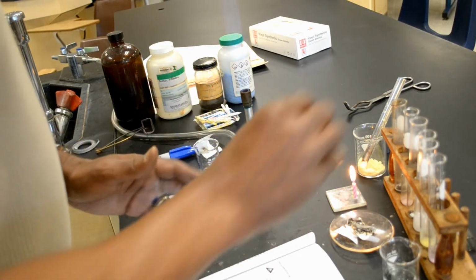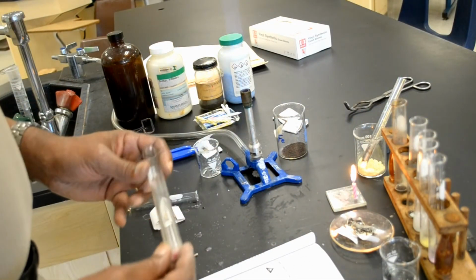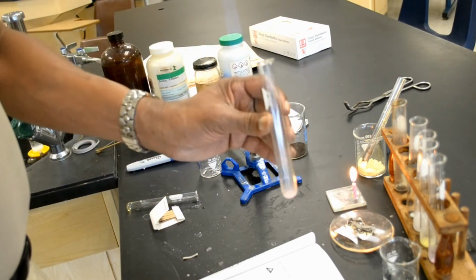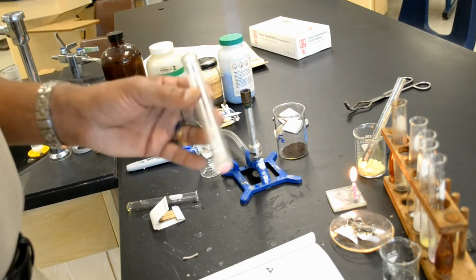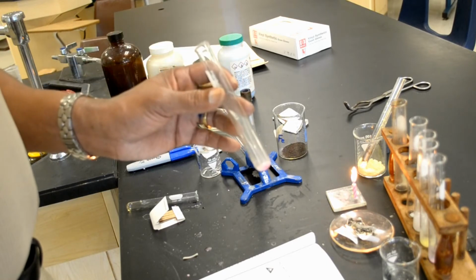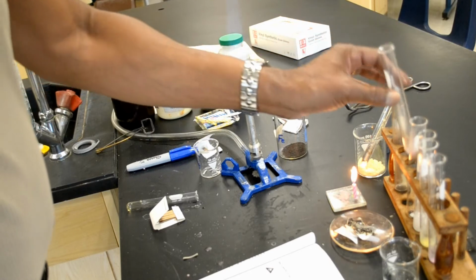Now before I do that, let's go back to the melted wax. Melting the wax is a physical change because wax is still in the test tube. If it had been a chemical change, the wax would have become something else. But since this is still wax from the birthday candle, that was definitely a physical change.